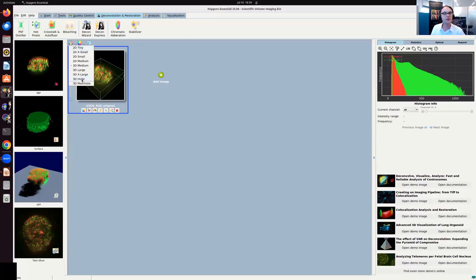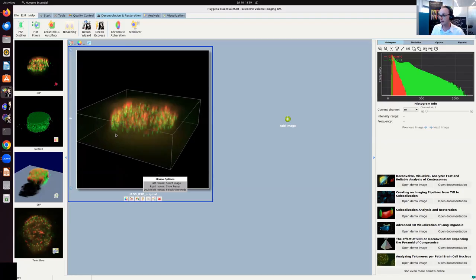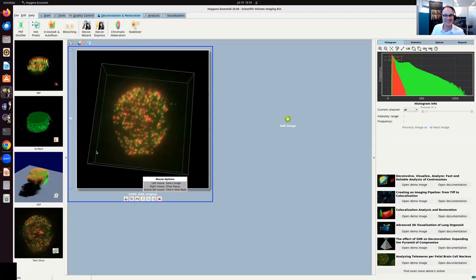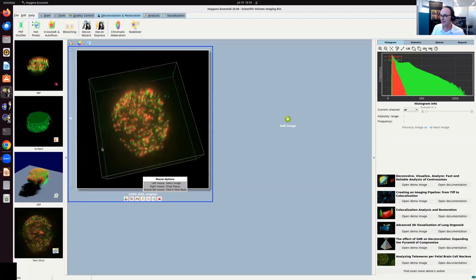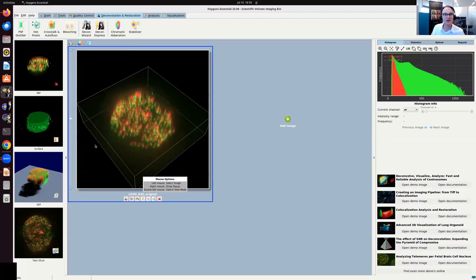Okay, so let me just go back to the demonstration. This is the data that I've been showing also in the presentation. These are the kinetochore complexes with the chromatin bridge. I made my image a little bit bigger by using this preview. I set it to huge preview.